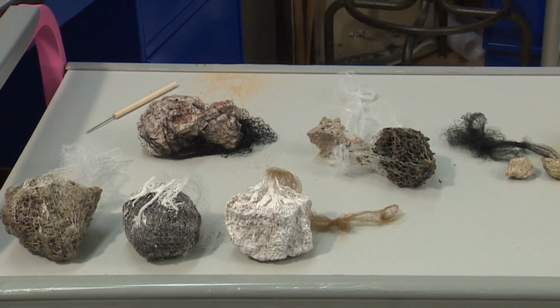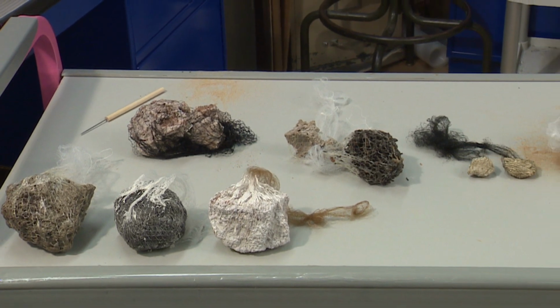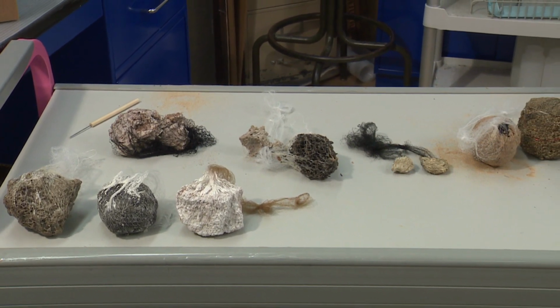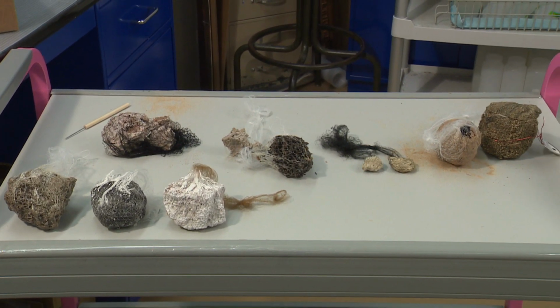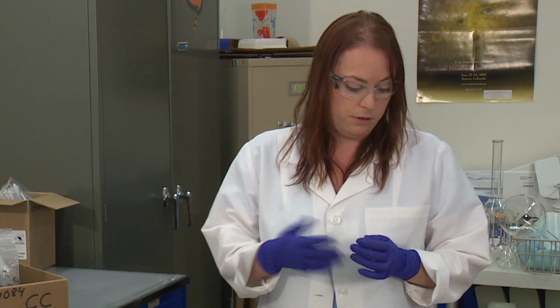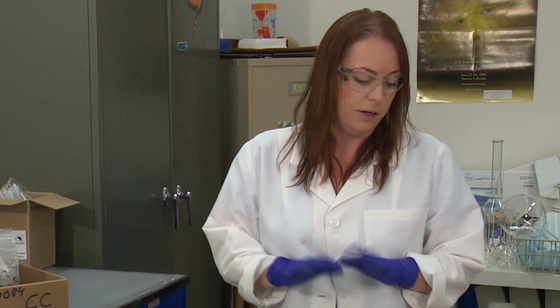Another thing with these clods is when they do come in, if they do make it through transportation, then oftentimes we have problems with these falling apart when we do saran dips in the lab, and when we cut them on the saw to make that flat edge, they also come apart. The contents will fall out during that part, and then the clod is not usable.